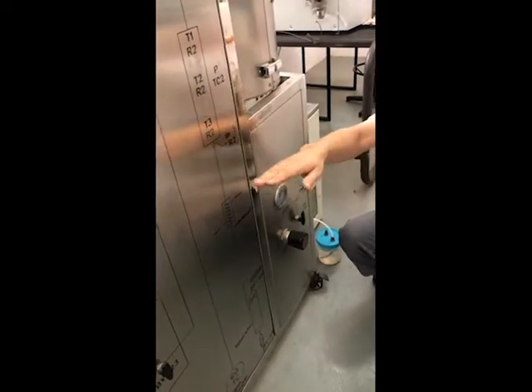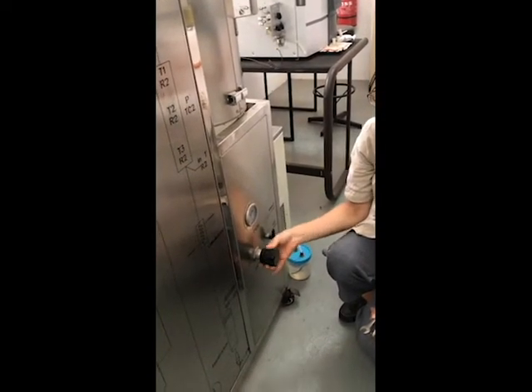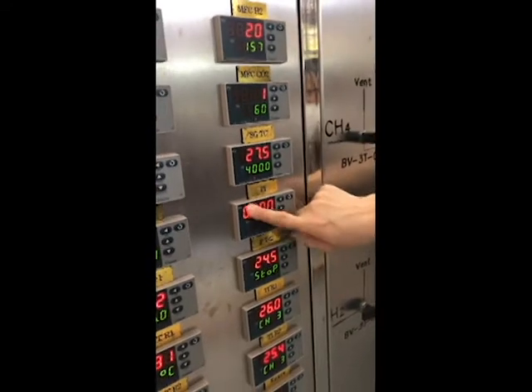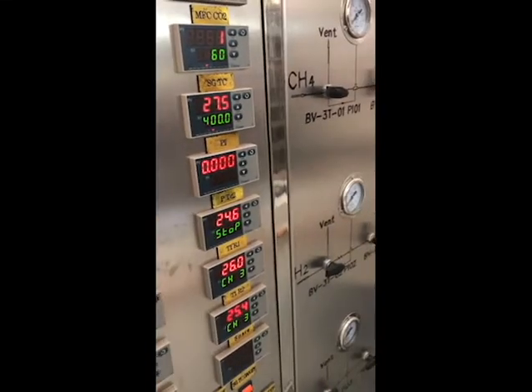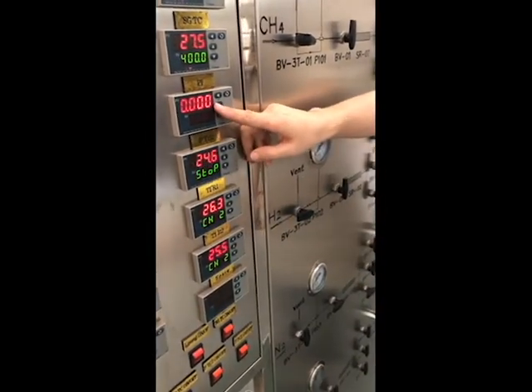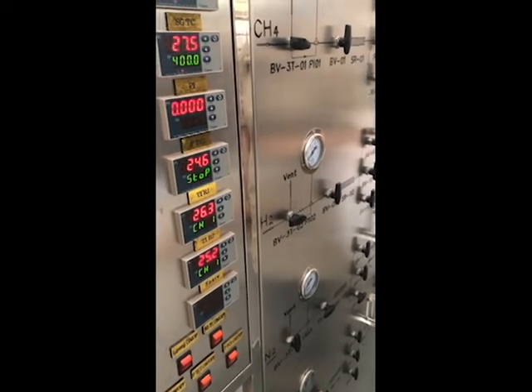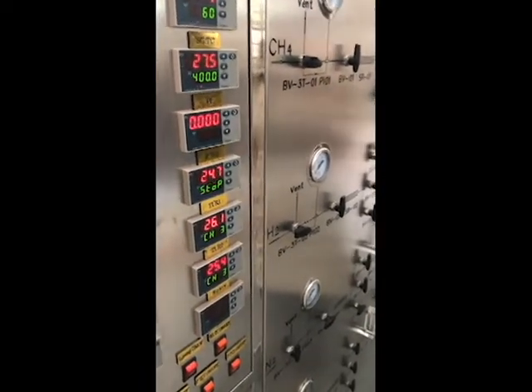Then after we lead the gas in here, we adjust. We open slowly and check the PI. Now you cannot see it, but later we can observe. When you adjust the back pressure valve, you check the PI. You set it to a predetermined value, then you can stop. If you find the pressure here cannot reach your setting value, for example you want to set 0.1, but even when you fully close it, it's still lower, that means the pressure outside is not enough, or you haven't really opened the cylinder. If that happens, you go out to check your gas source.